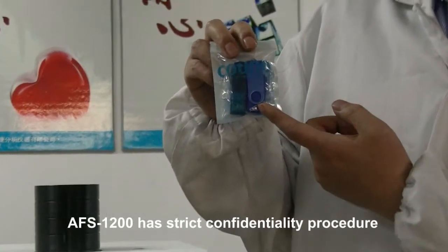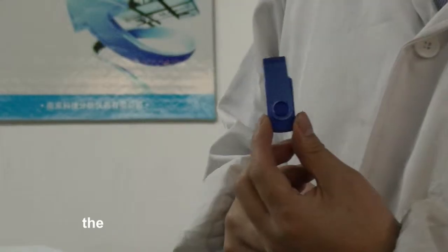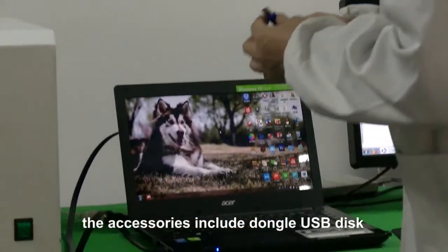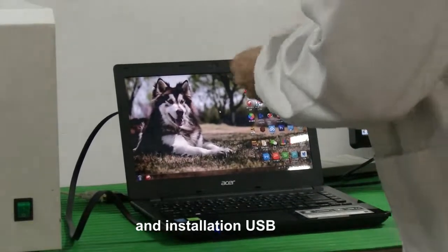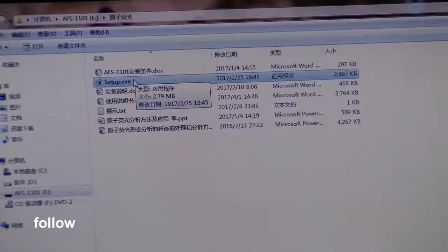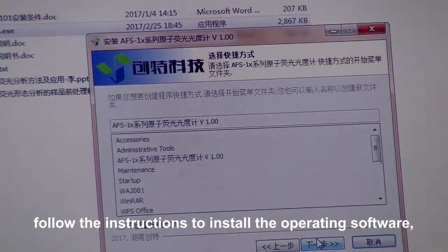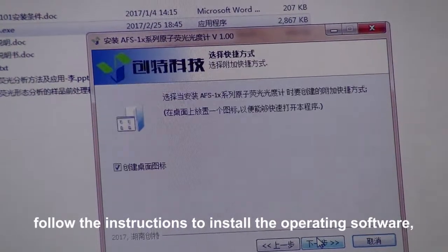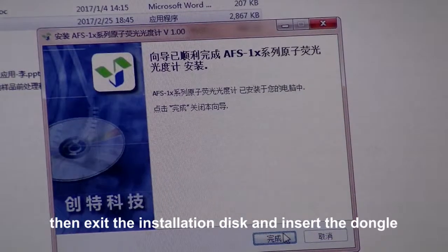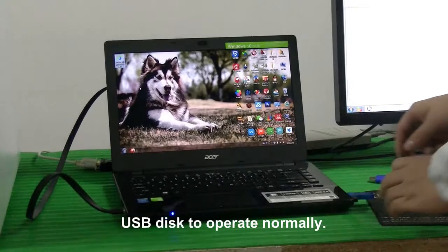Step 2: Operating software installation. The AFS1200 has a strict confidentiality procedure. The accessories include a dongle USB disk and an installation USB disk. First, insert the installation USB disk and install it. Follow the instructions to install the operating software, then exit the installation disk and insert the dongle USB disk to operate normally.